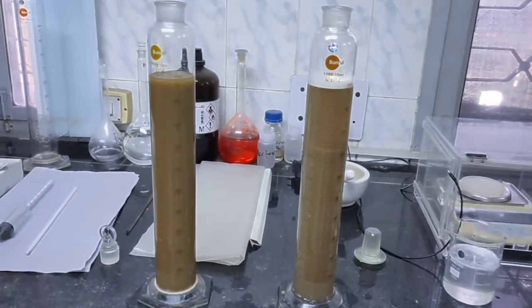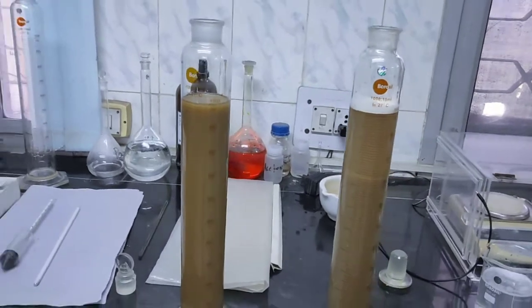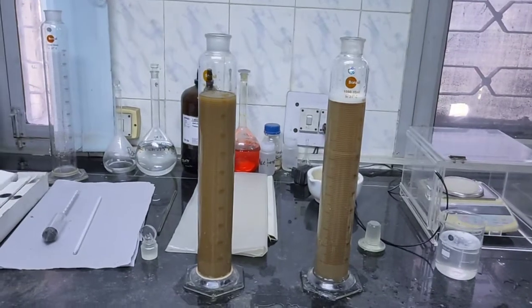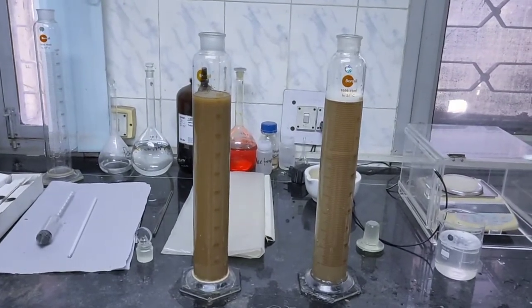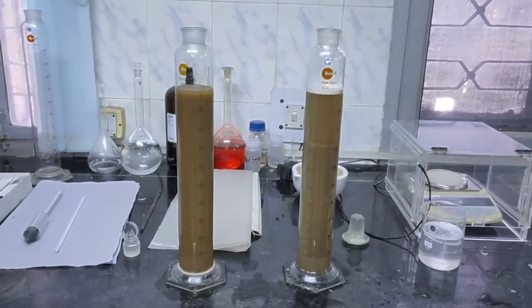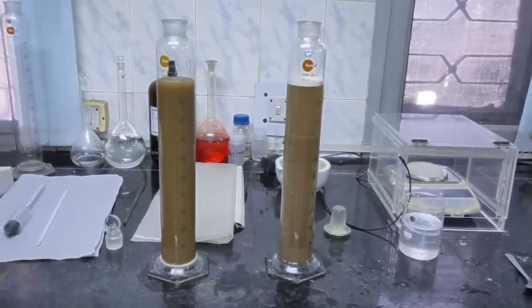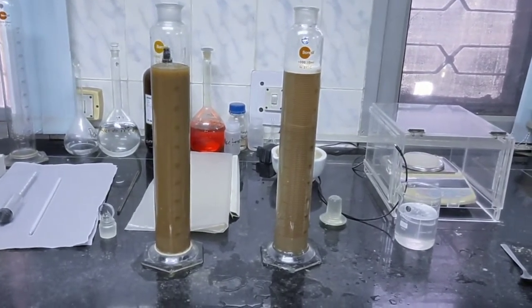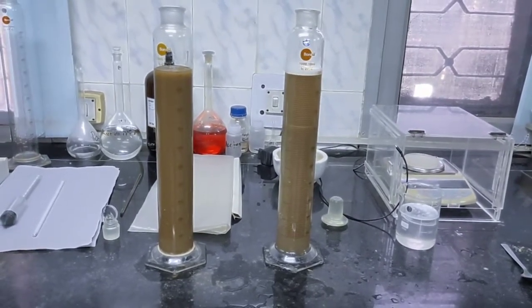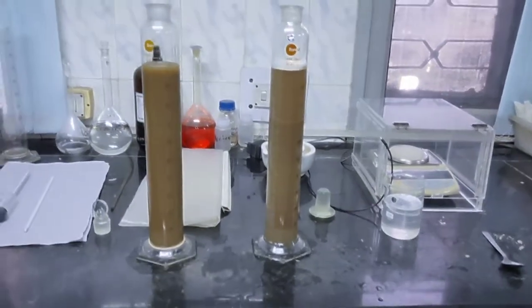The two samples are now ready in suspension — this is a one-liter measuring cylinder. Briefly, the steps are: you have taken 50 grams of soil which was passed through a 2mm sieve, meaning all the soil samples are less than 2mm in size. Then you added H₂O₂ to drive away the organic matter.